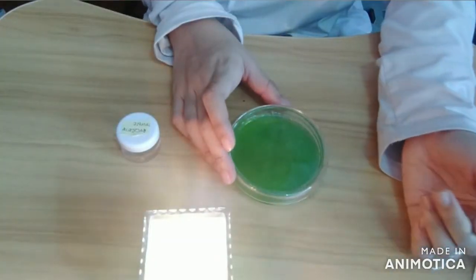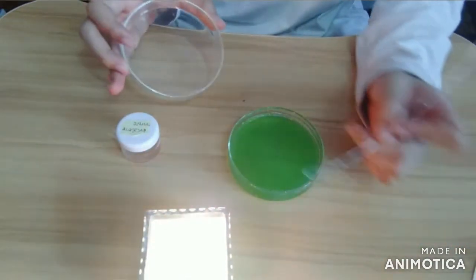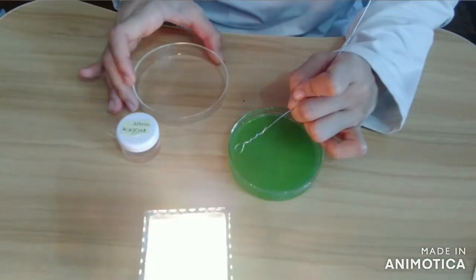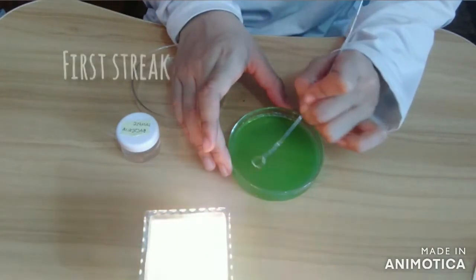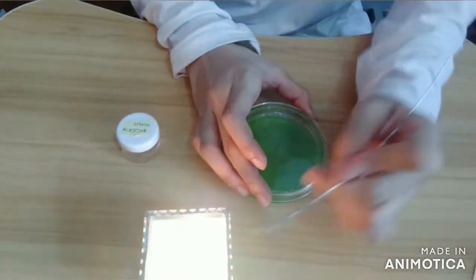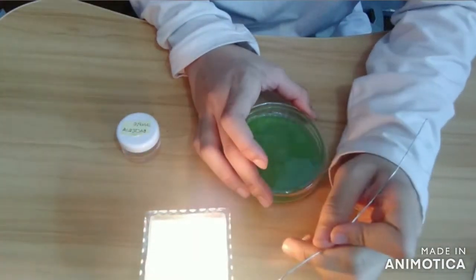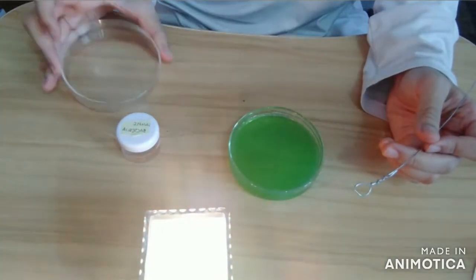After the sample has been taken, gently poke the surface of the agar and drag your inoculating loop across the surface to create the first streak. Before you go for another streak, make sure to close the lid of the petri dish to prevent any contamination, and reflame your inoculating loop.